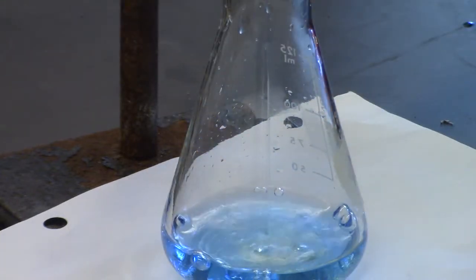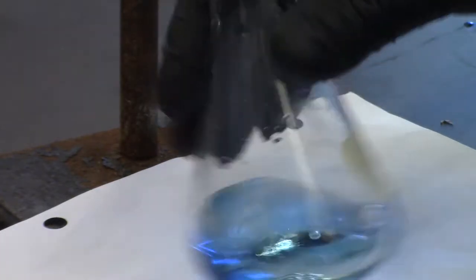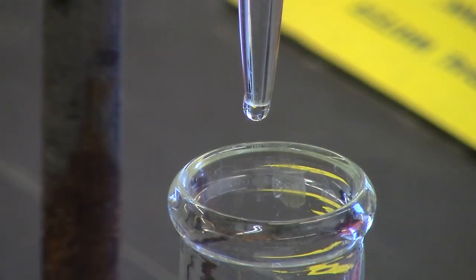Remember to record the initial and final burette readings to the hundredth decimal place, 0.01 milliliters. To achieve an optimal titration, you want to adjust the stopcock on the burette so that it delivers drop by drop.